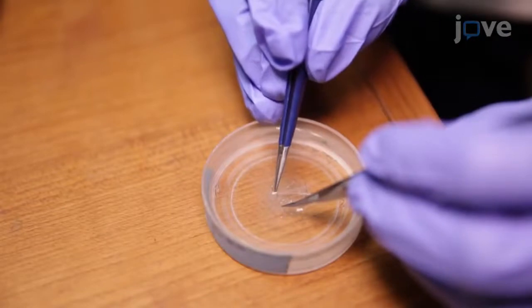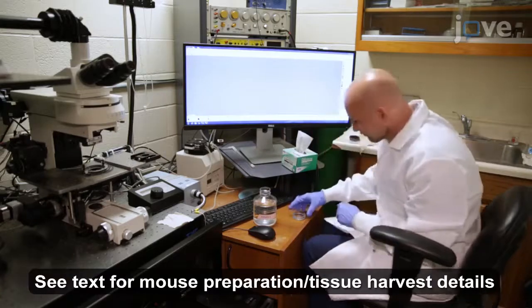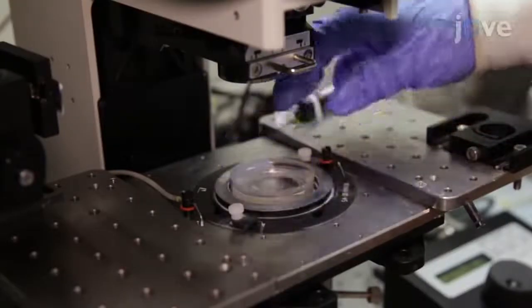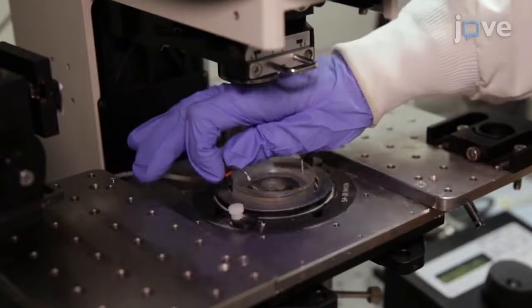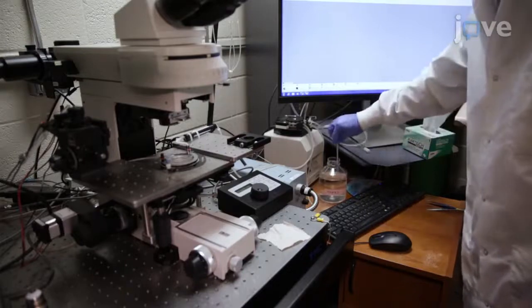One hour before the imaging, transfer a small intestine harvested from a mouse with interstitial cells of Cajal, or ICC, that specifically express a genetically encoded calcium indicator to the stage of a spinning disc confocal microscope and continuously perfuse the tissue with 37 degrees Celsius Krebs-Ringer bicarbonate, or KRB, solution.